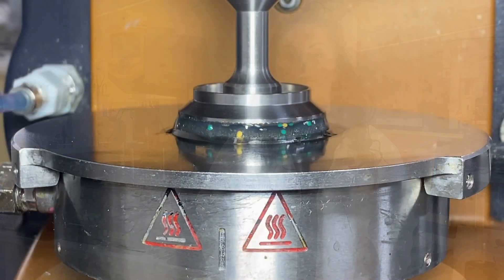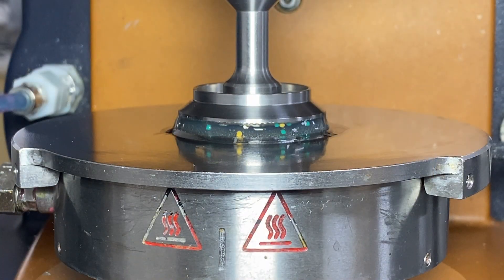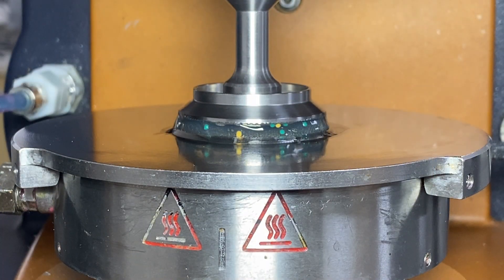By performing an oscillation temperature sweep, where the sample is wobbled back and forth as temperature rises, we can see the powder dissolving in water simultaneously to the rheological data.